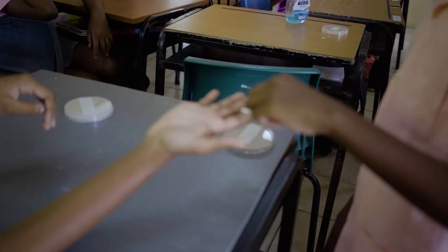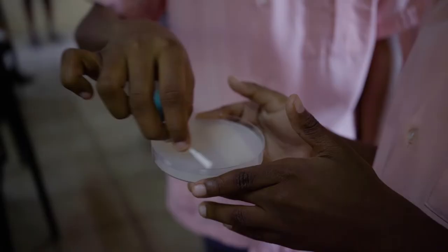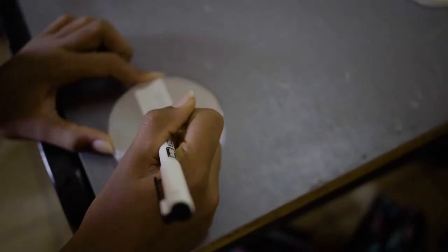This was placed in a microwave for four minutes and the hot agar was poured into petri dishes and was allowed to cool. Eleven of our classmates volunteered to be our test subjects. We got a brand new set of cotton swabs and swabbed the volunteers' unwashed, unsanitized hands.